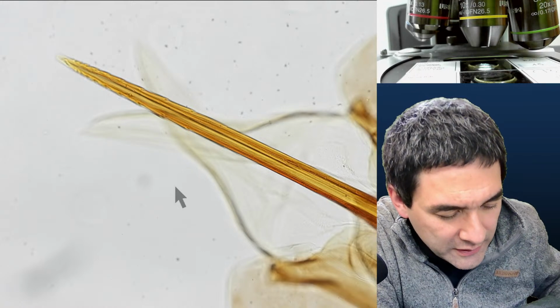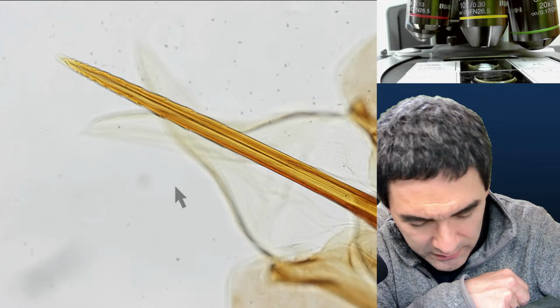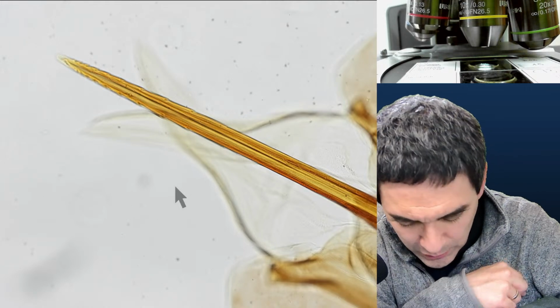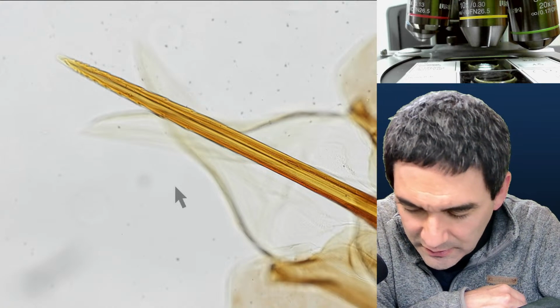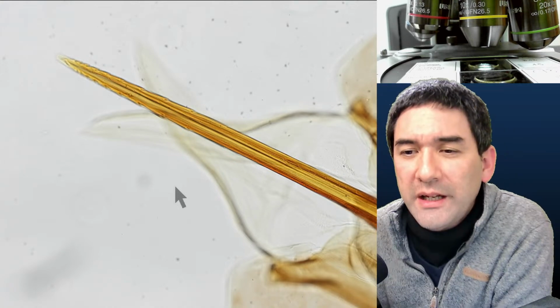I don't know, maybe these are not the ones here. Varroa tick. Okay, tick. Mosquito wings, mosquito legs, mosquito. So many mosquitoes. But you know what, people? What time is it now? It's already 1 hour 24 anyway.